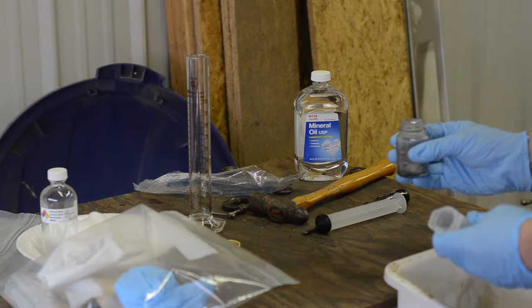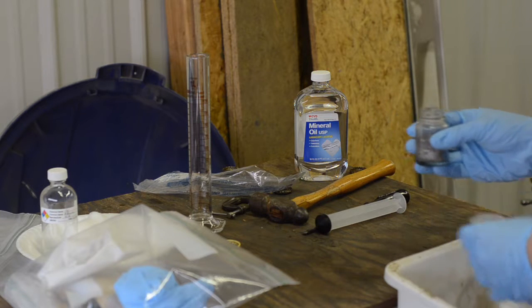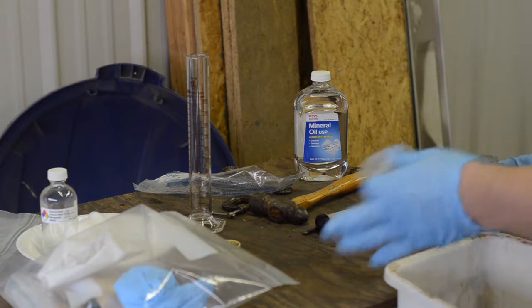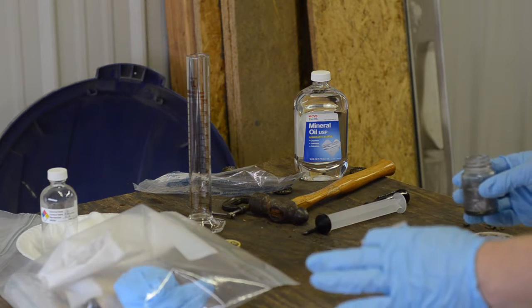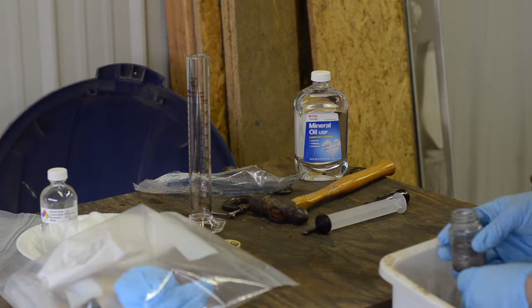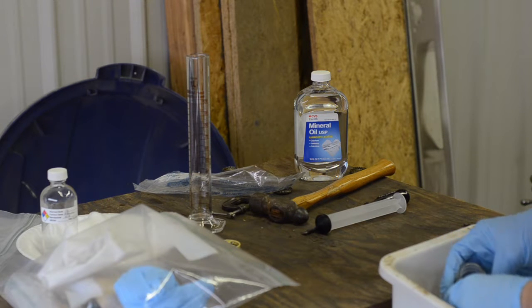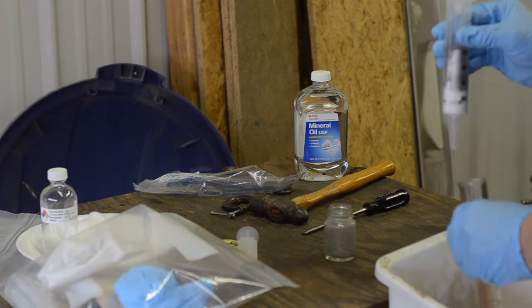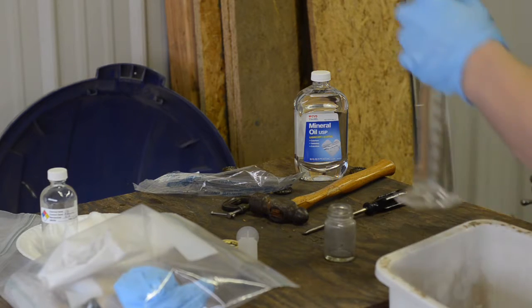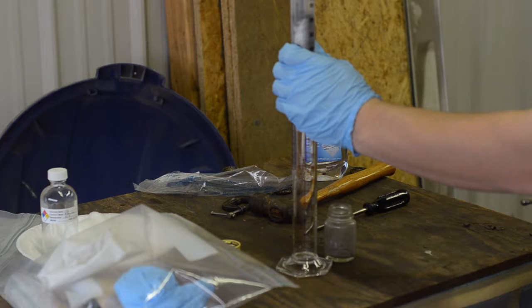So the next stage is to fill up my mechanical filter with this dirty mercury. I'm not interested in a mercury spill in the shop here, and this is probably the most dangerous part. So I'm going to do this over this garbage can so that if I do spill any, I can capture it. All right, so now we'll place this in my graduated cylinder. And now we can mechanically filter it.